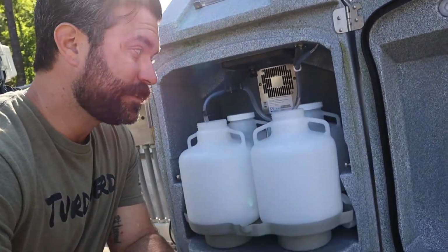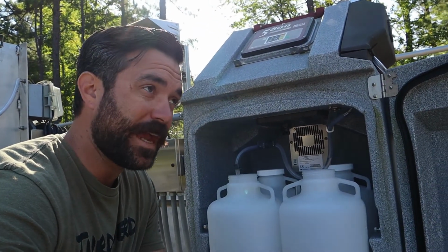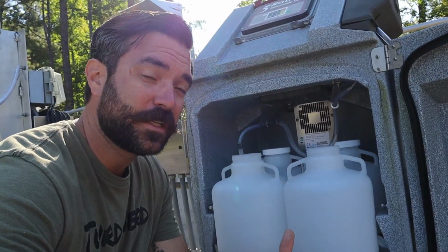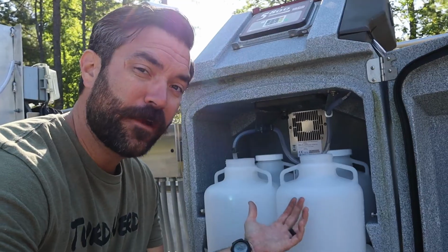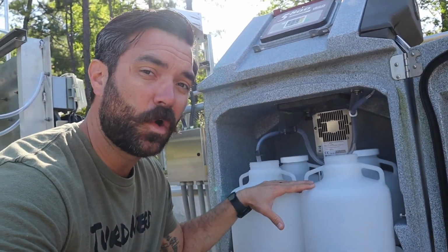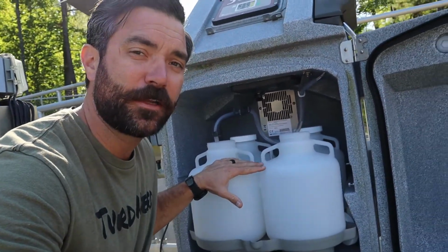Now this is not necessarily going to be on your exam, but this is something you need to be familiar with as an operator. If your regulatory agency comes in and they do an inspection, they may ask you, how can you verify that your sample is staying cold and that there's nothing else going on regarding the sampler? How can you verify that?